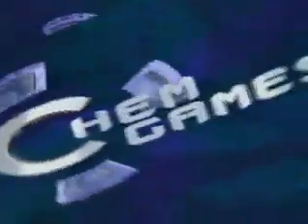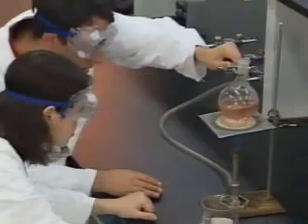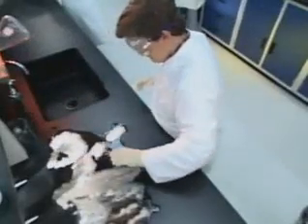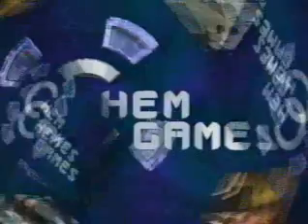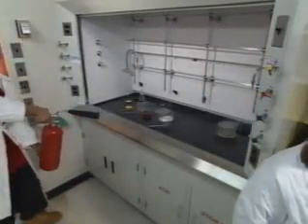Well, Adam, we've come down to the moment of truth. Time to tally the score. While the judges confer, it's time to select our Chem Games play of the day. Yeah, and that's a tough one. We've seen good chemical handling and use, safe Bunsen burning, and good hand scrubbing and spill cleanup technique. Those are all candidates. But look at the way this guy puts out this fire. Whoa! If they win, it will be this perfect 10 that puts them over the top. That gets my vote. I'm with you.